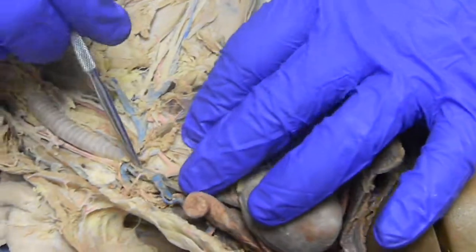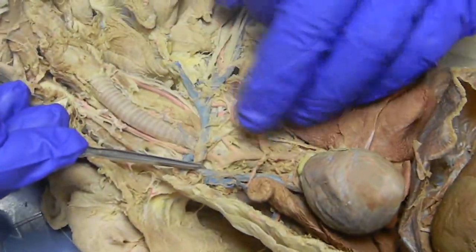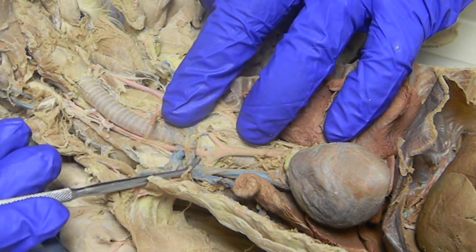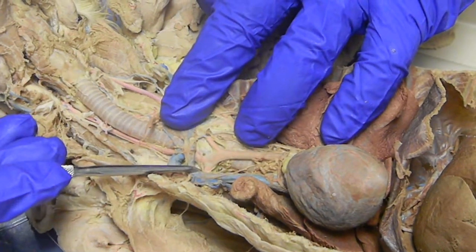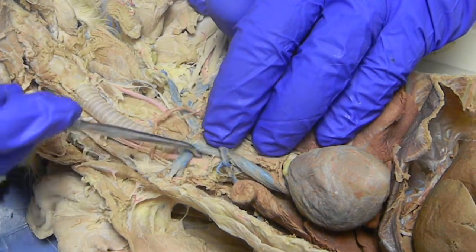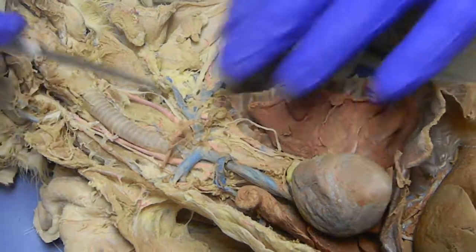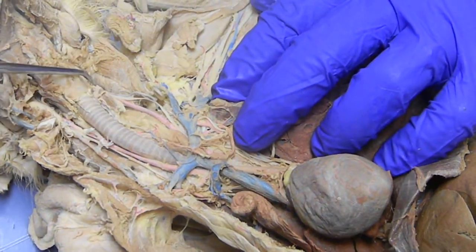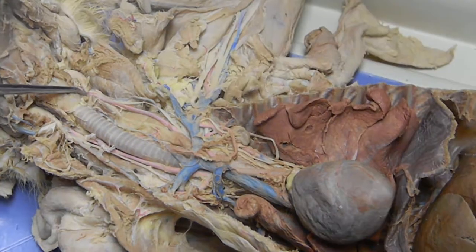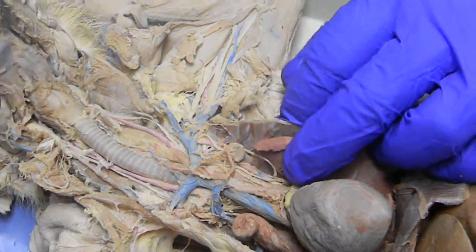The brachiocephalic is going to divide three times. So we have the left common carotid, the right common carotid, and the right subclavian. The common carotid continues up. It should break into the internal and external carotids, but the cat does not have an internal carotid — it's filled in. So we don't go any further than that.